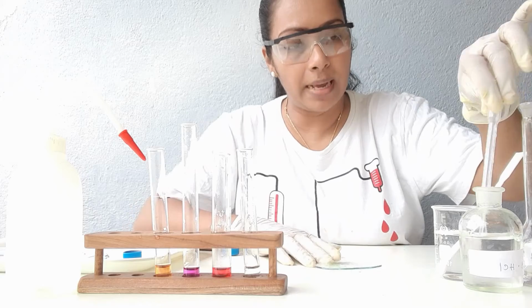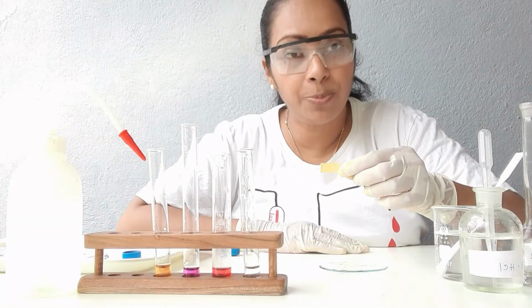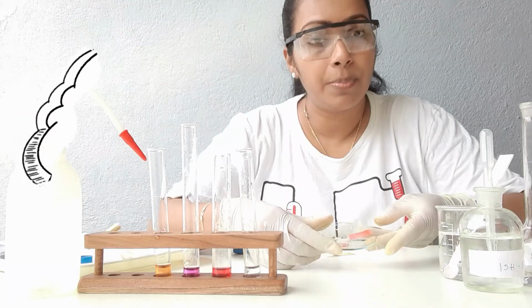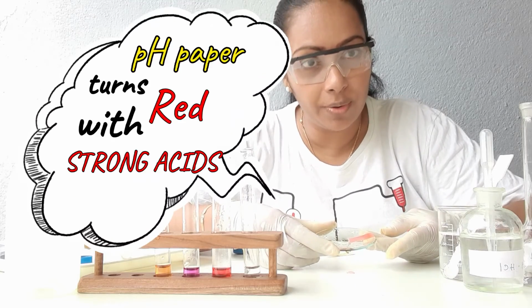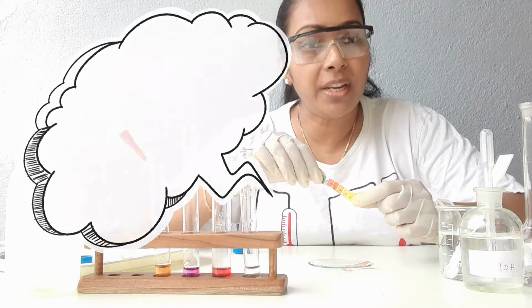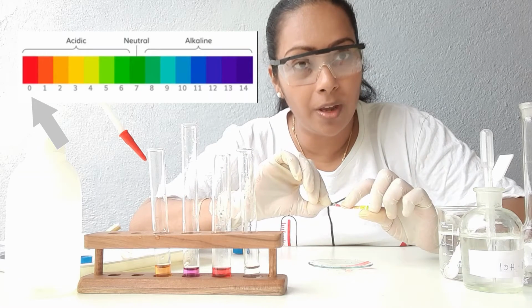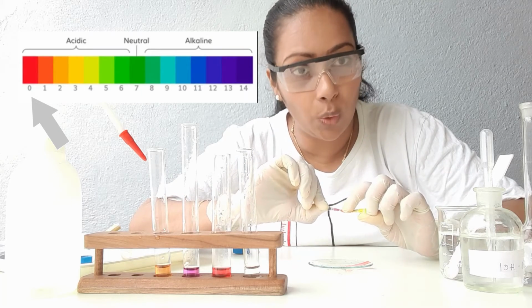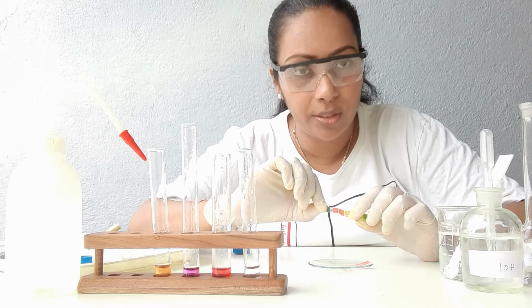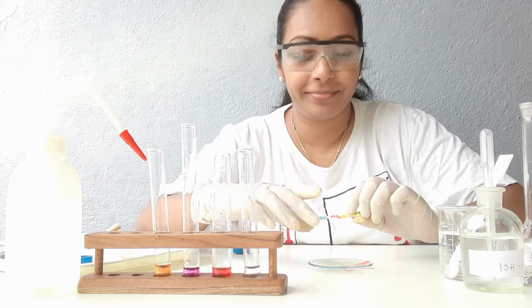Let's try out the acid first. pH paper is yellow in color. pH paper turned into dark red with hydrochloric acid. When you check with the pH scale, dark red is somewhere near pH 0, which is a very strong acid. So we know hydrochloric acid is a very strong acid.